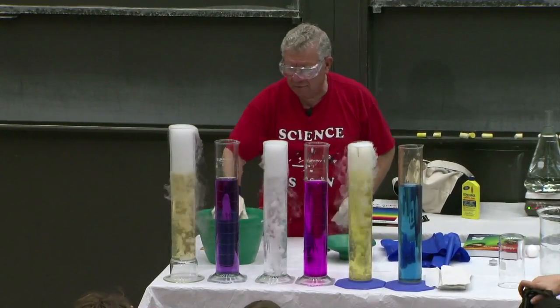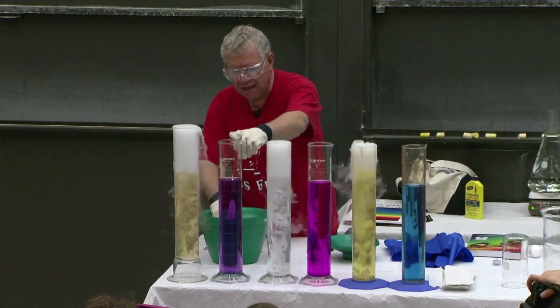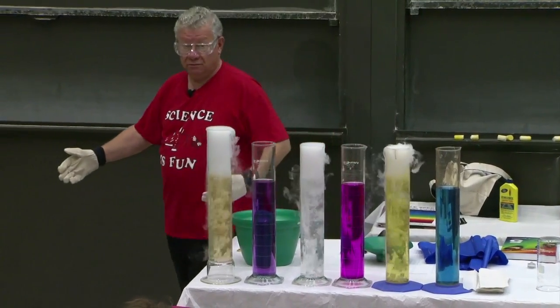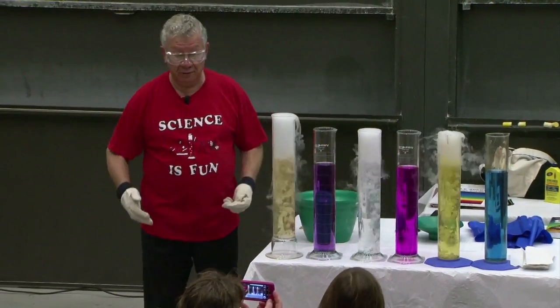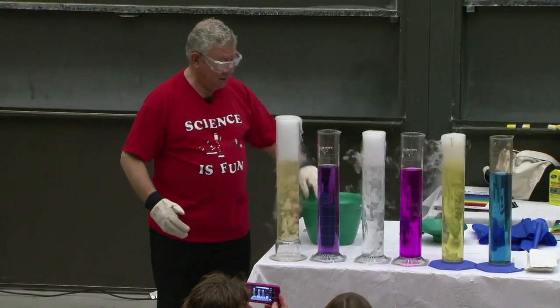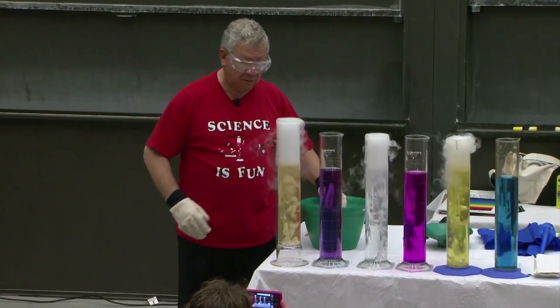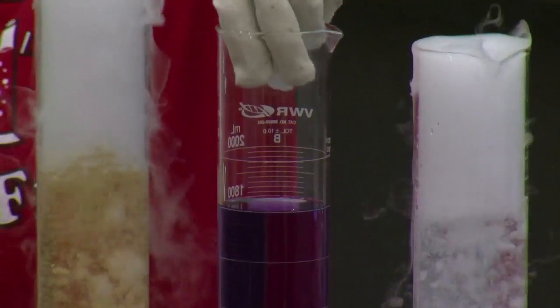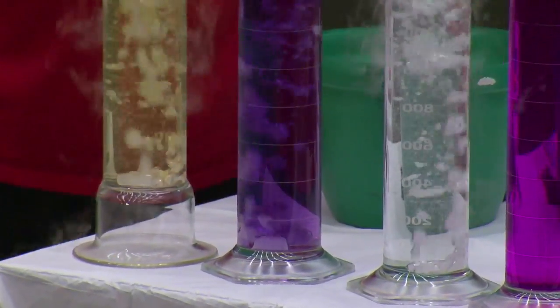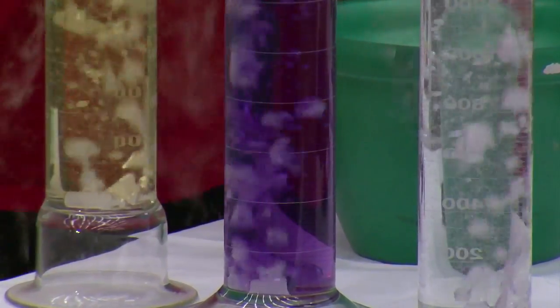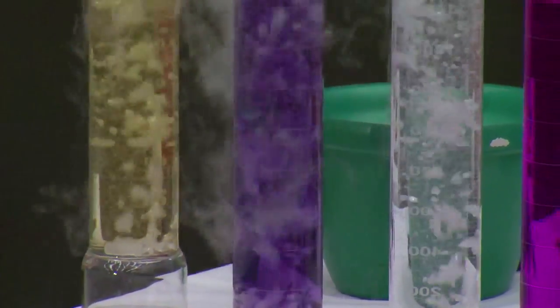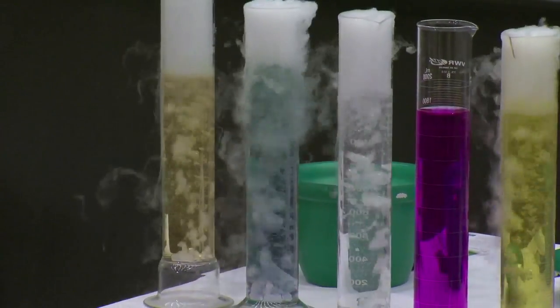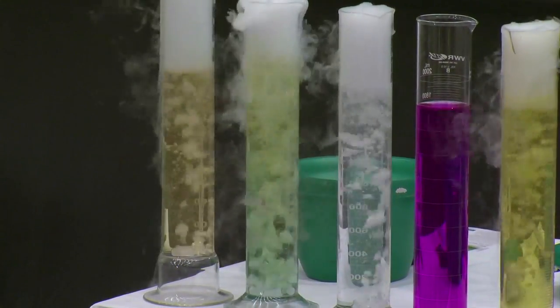So now, I ask you to focus your attention on this cylinder. Actually, you can focus your attention on anything you want to. You can even not pay attention if you want to. We live in a free country. But if you want to follow the experiment with me, I want you to focus your attention on this one. And tell me, count them out, how many different color changes you see as I drop the dry ice in there? I'm listening to you on the radio. One? Wow, I heard wow. What kind of a count is that?